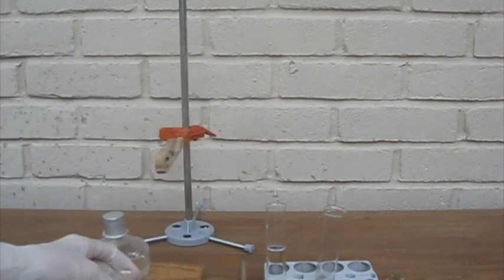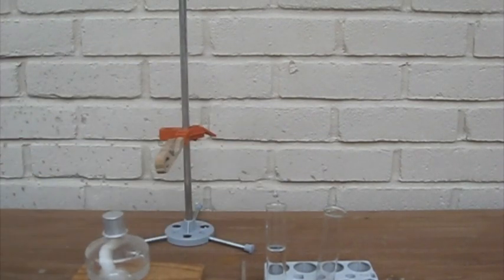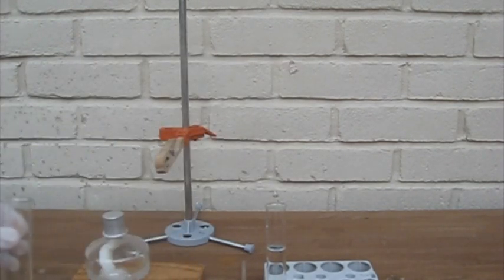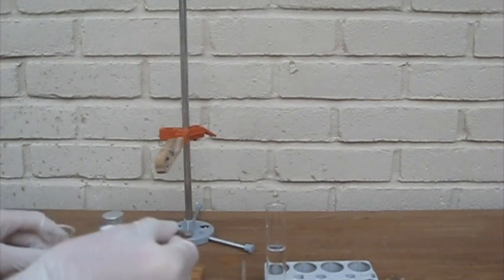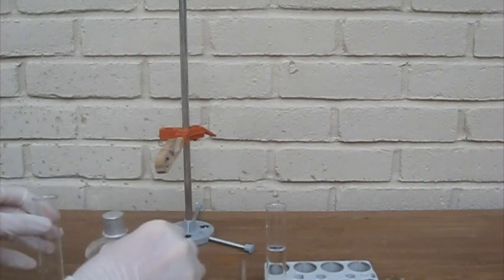Here is some salt. And here's an empty test tube which will be the reaction vessel. So I'm going to take a small amount of salt. You can scale this up.